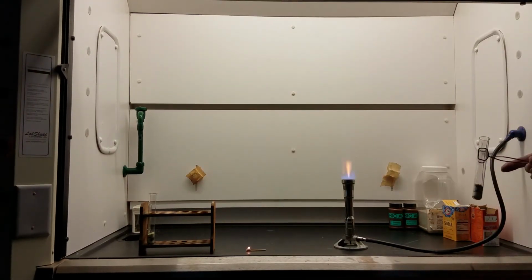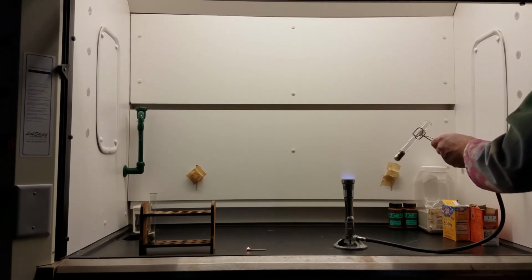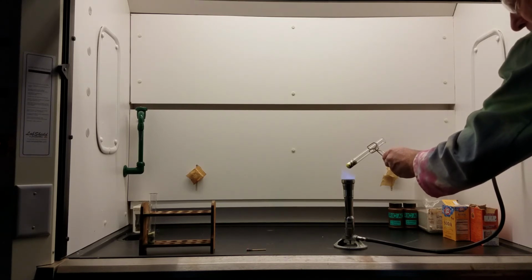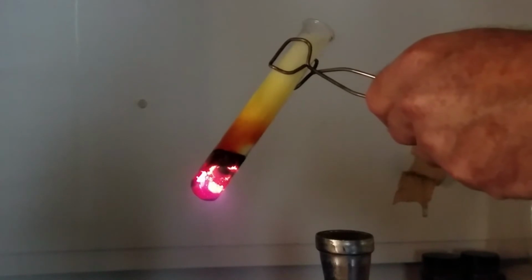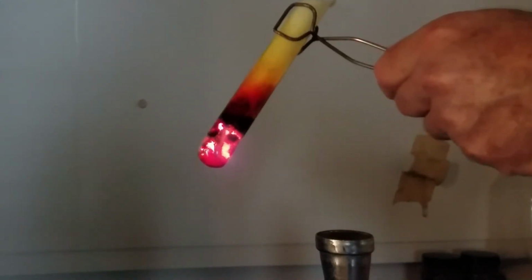And I'm going to turn the lights off in the fume hood so we can see this better. And I'm going to begin to apply some heat to the iron-sulfur mixture, like that. And what I'm doing is I'm going to begin to look for a glow inside of the test tube, right about there. At this point, I could cut the heat from the burner, and we see the test tube continues to glow, because what is happening now is the iron and sulfur are reacting chemically.